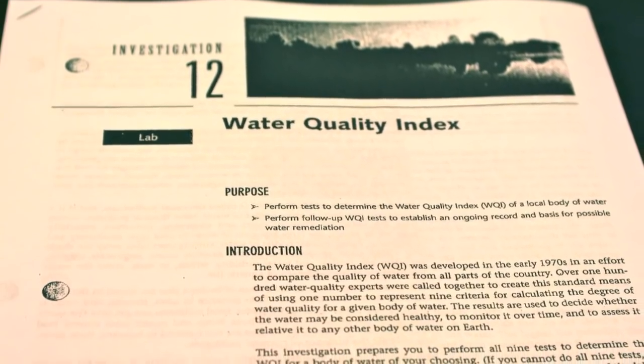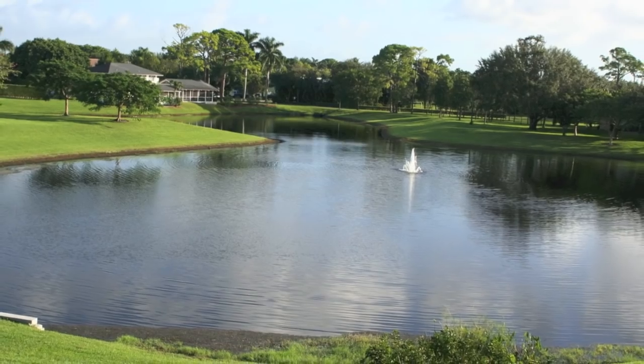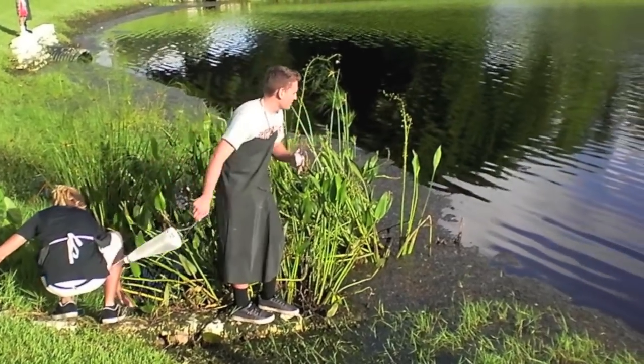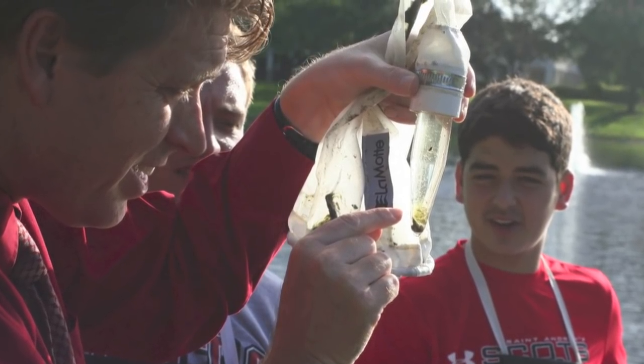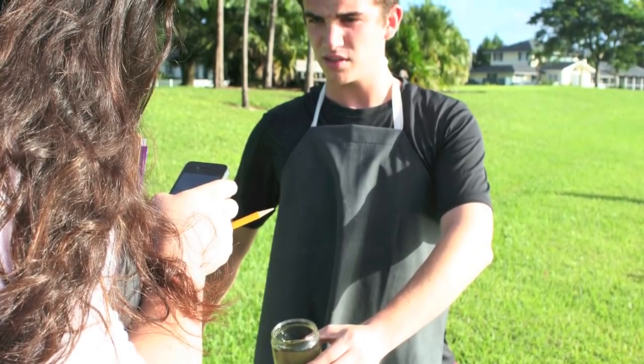My name is Adam Caffey and today in AP Environmental Science we're going to be doing a full water quality index study of the school's local pond. We're going to be using a number of tools that environmental engineers would actually use in the field to do the same exact sort of assessments that we're going to be doing here in the classroom.